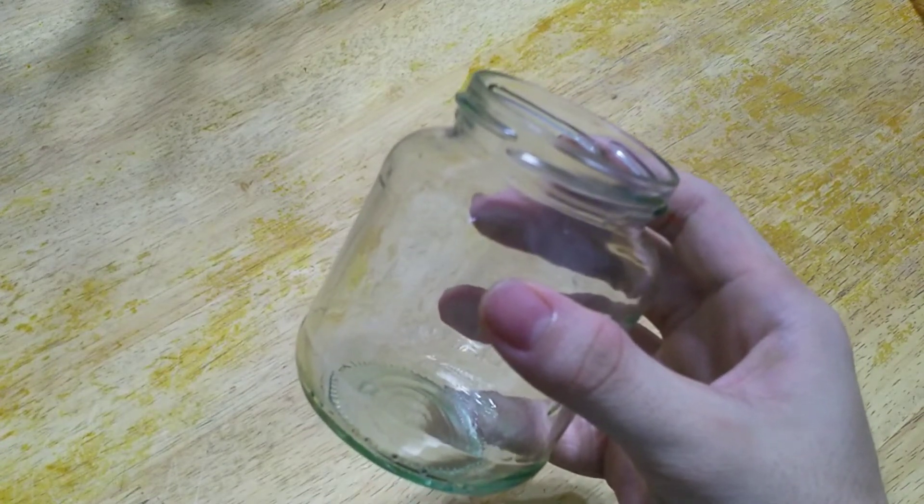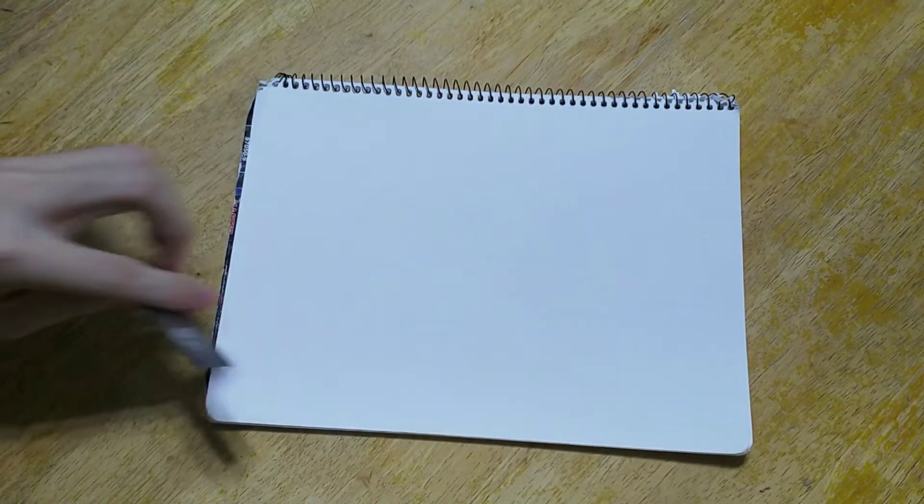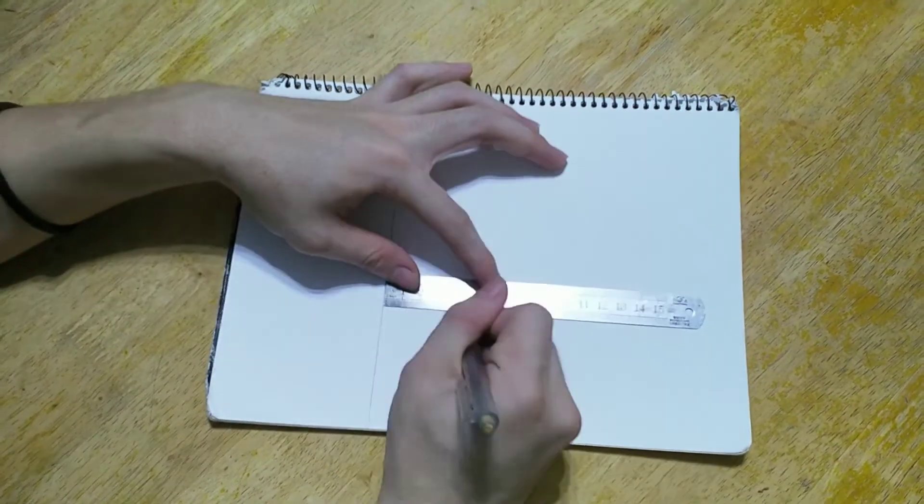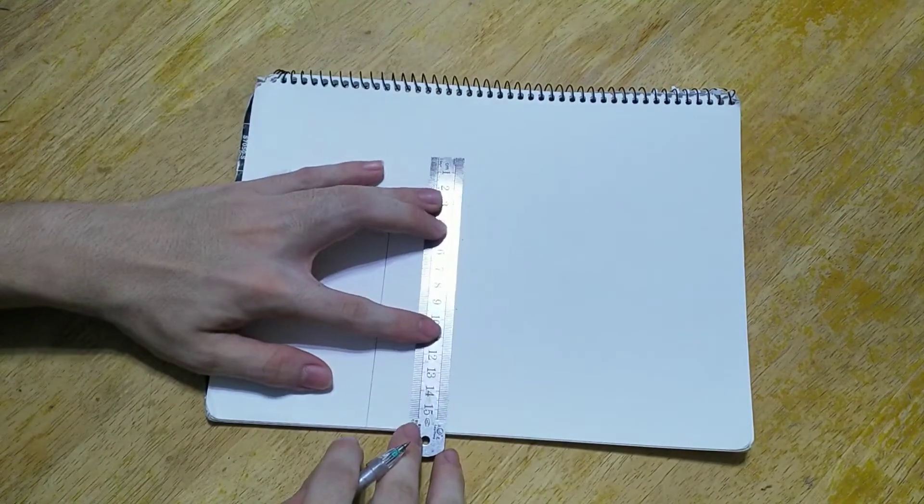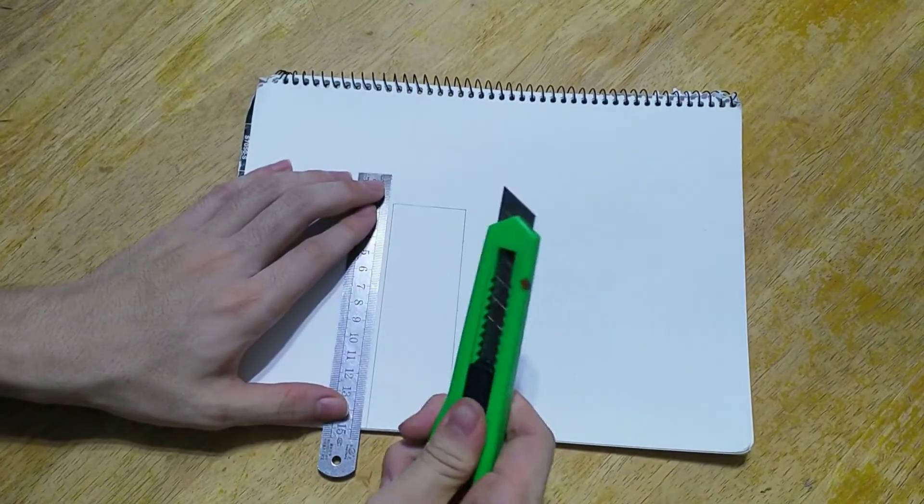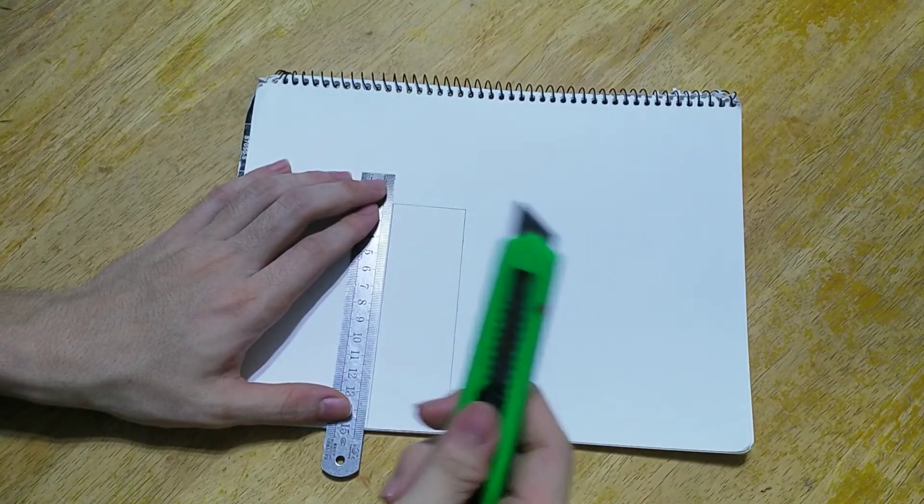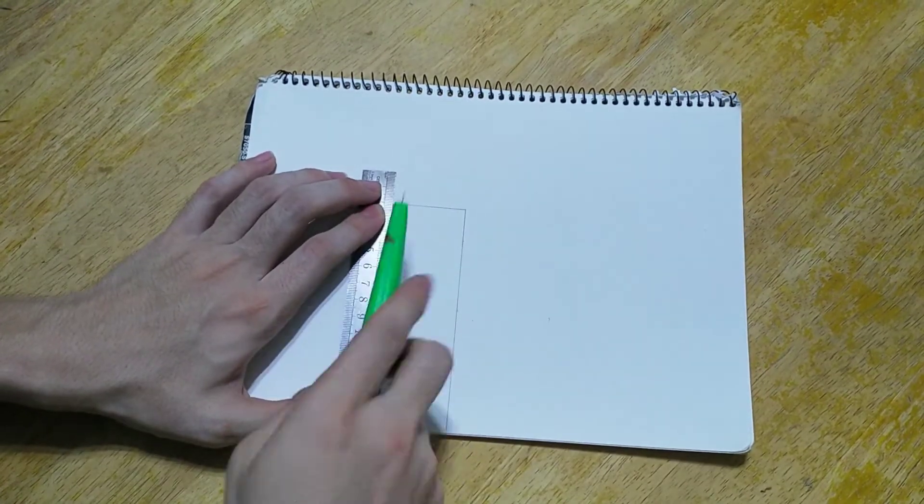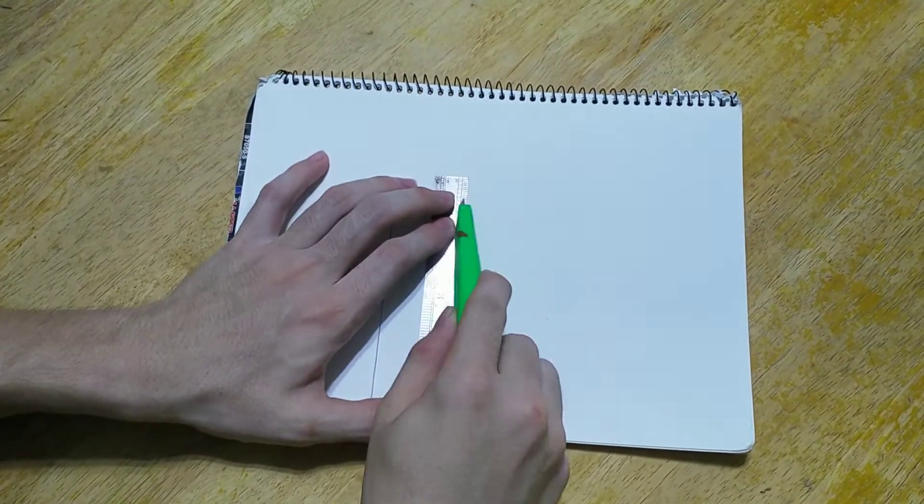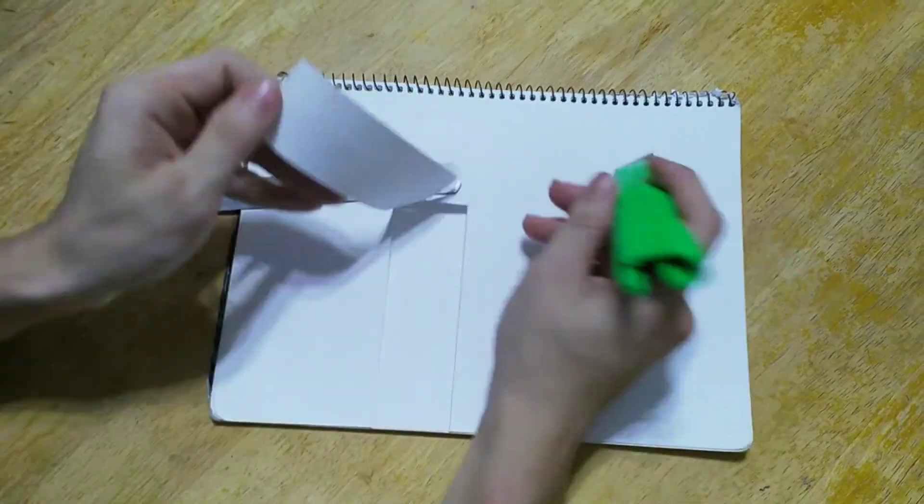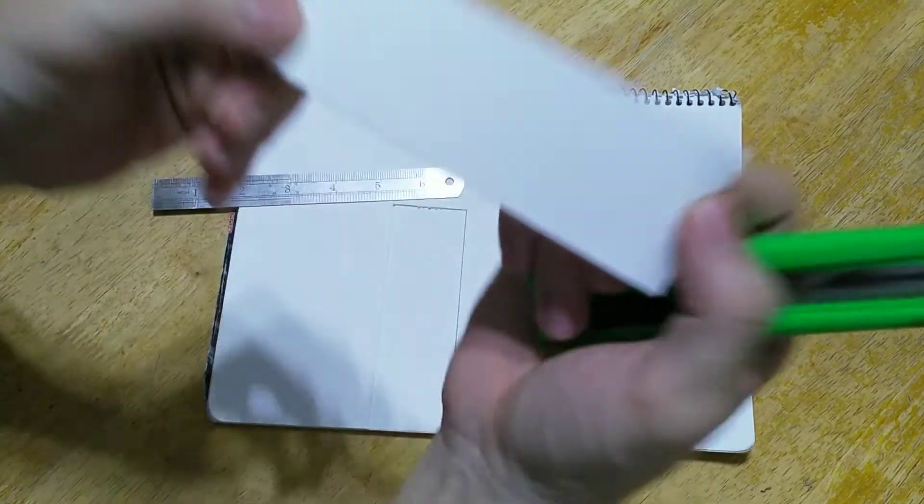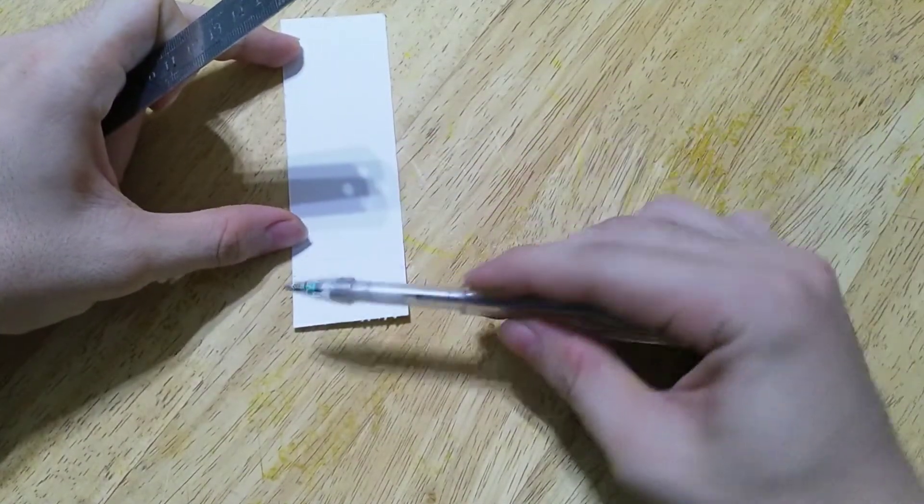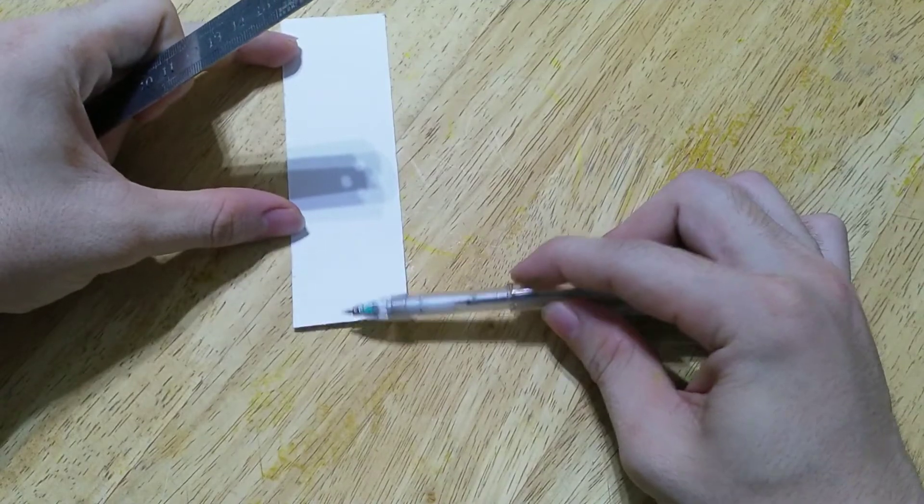So let's start our experiment. Now I'm going to draw and cut out my TLC plate. So let's do it. Remember, be very careful when you handle a sharp knife. So this is going to be my TLC plate.